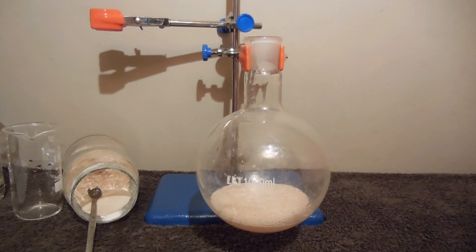Then filter it from contaminations and start heating. Crystals of calcium acetate will start growing.